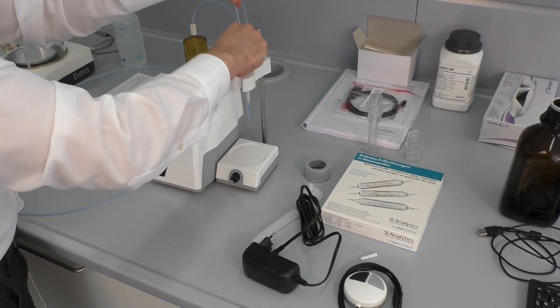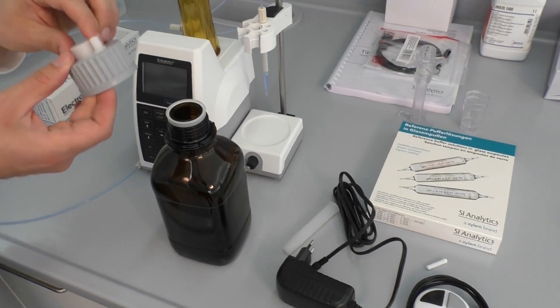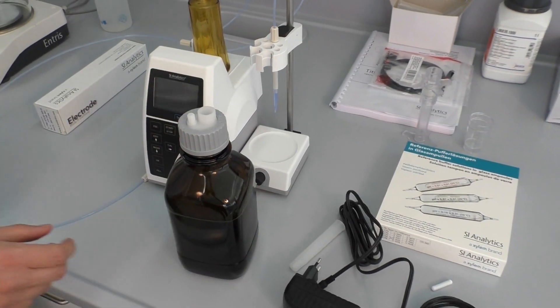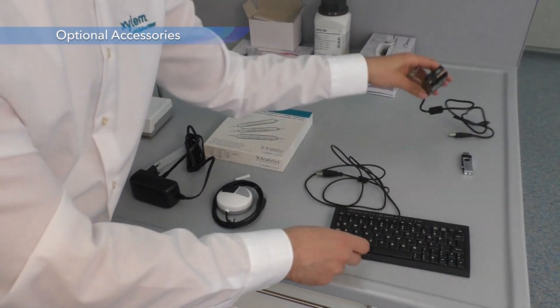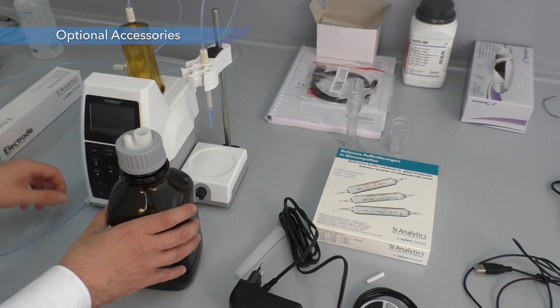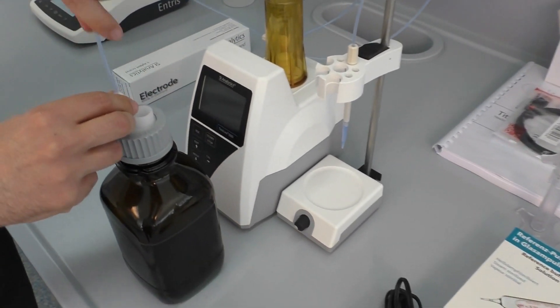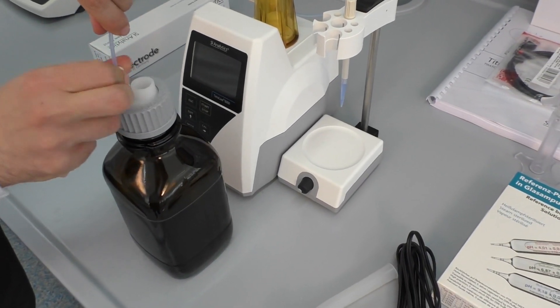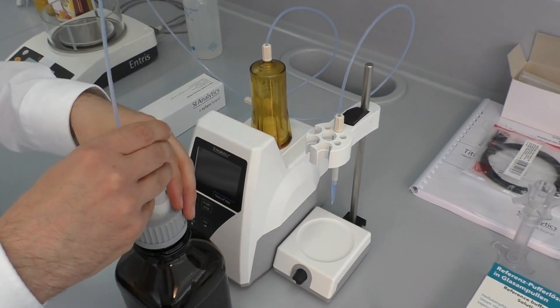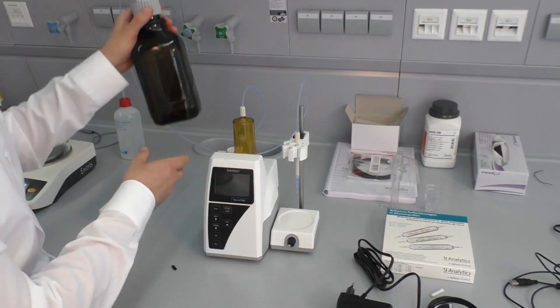Now we can attach the stand rod together with the titration clamp. The titration tip is attached. We can mount the adapter for the reagent bottle, which is not part of delivery and is an optional accessory. Also a keyboard, USB hub and a memory stick are optional accessories. The tube is connected to the reagent bottle. We can attach this little tube which can be used, for example, if sodium hydroxide is used as titration reagent, to fill in soda lime as protection against CO2.